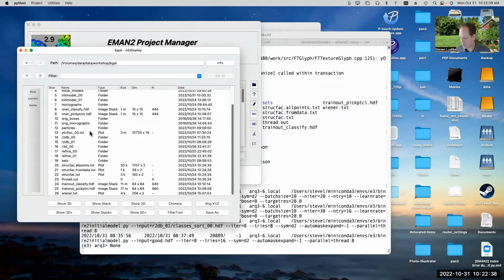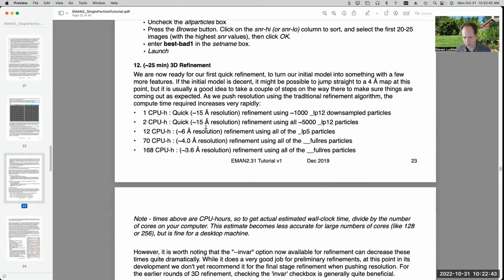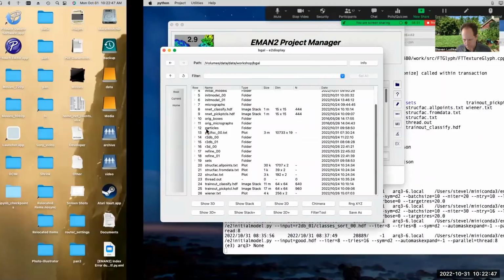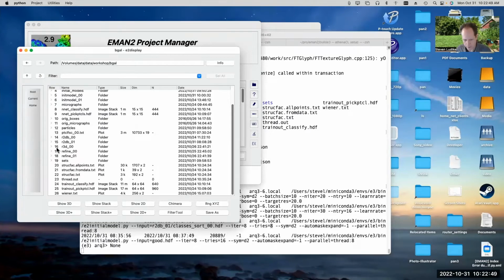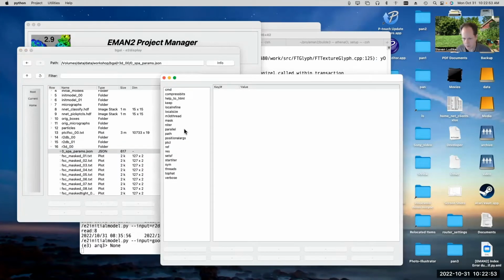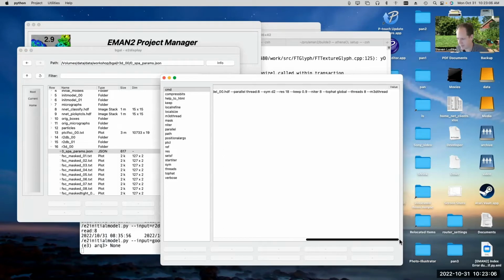They're approaching the sort of resolution that I said you could get if you did a nice final refinement in the third round over here. I also ran the new refinement program. You look at the command line there. This uses CMD instead of command line. There wasn't a reason for that. Muiwan just didn't think about it before he did it. Anyway, that's what it is in CMD.